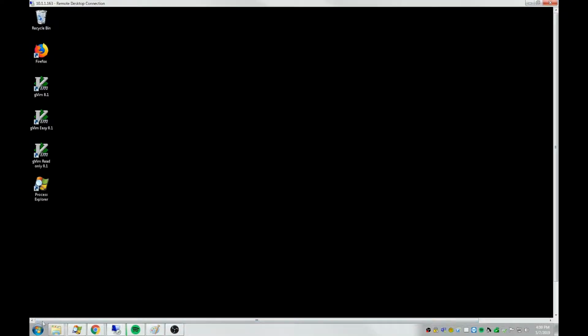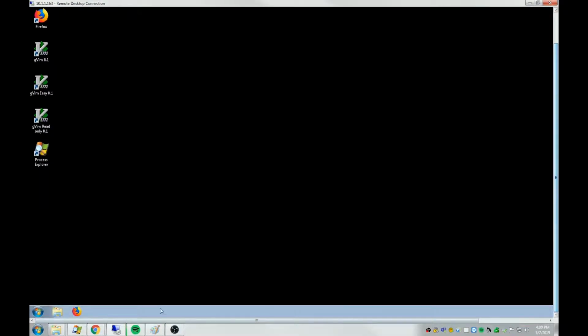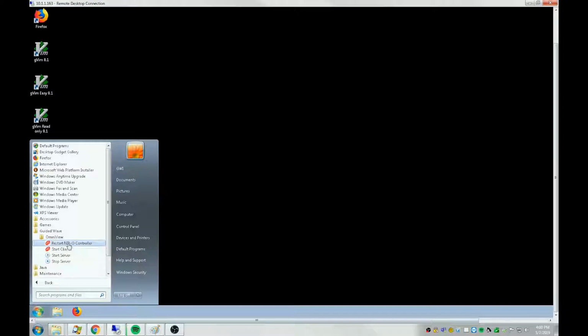Let's go take a look at what the other shortcuts are on the server. Shortcut here to restart the NIR-O controller program. You have a button here to stop the OmniView server and start the OmniView server.